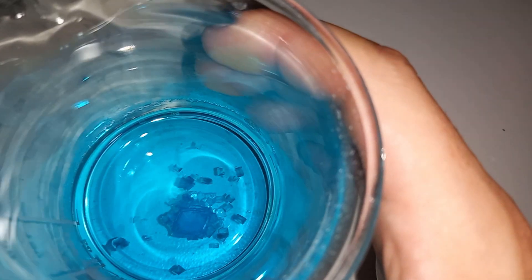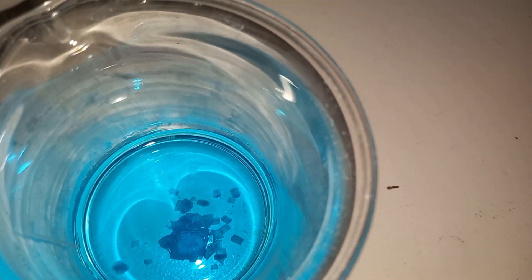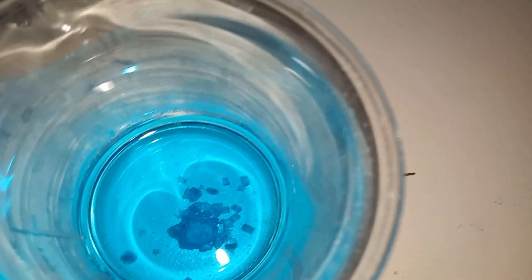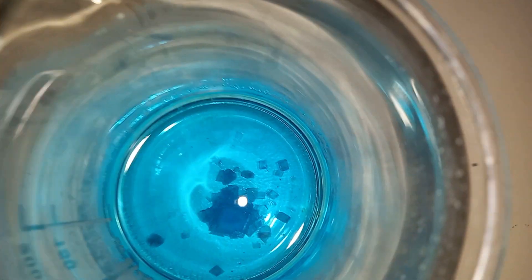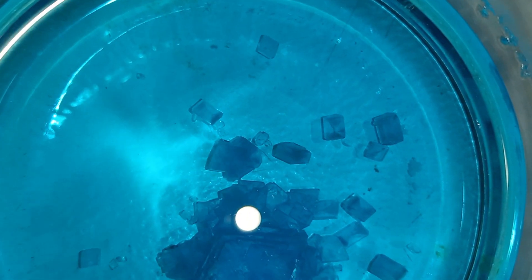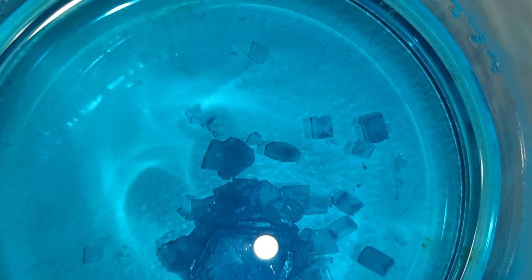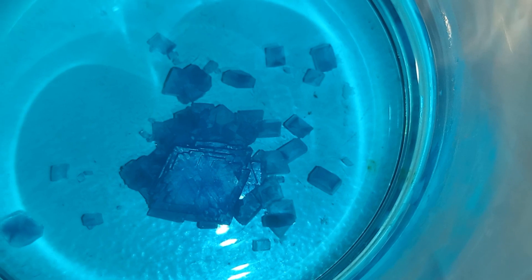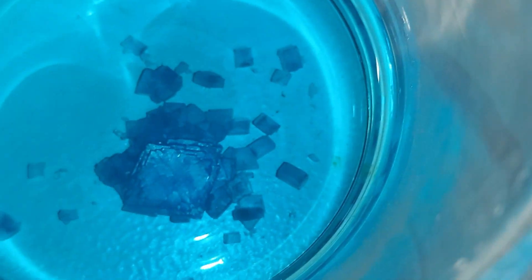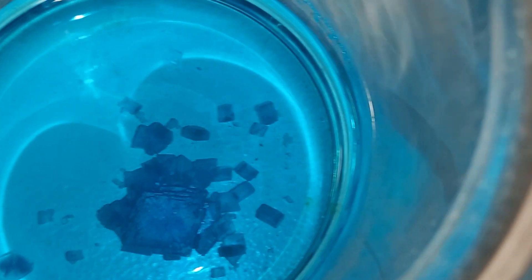I think it's pronounced 'croite' — I'm not sure. It's kind of interesting, it's a natural mineral. It should be quite a simple synthesis: just add a one-to-one ratio of potassium sulfate and copper sulfate together. But I didn't have any potassium sulfate, so I just made it myself by adding potassium hydroxide to a solution of ammonium sulfate, and I'm boiling off the ammonia to obtain a solution of potassium sulfate. I'm just making a short little video about the synthesis to entertain myself and you guys.